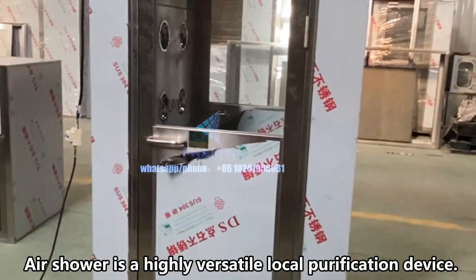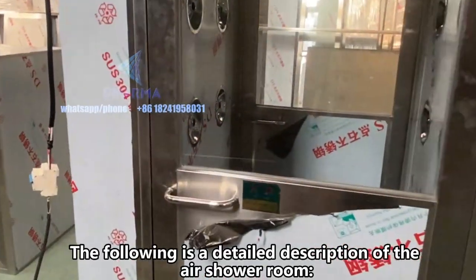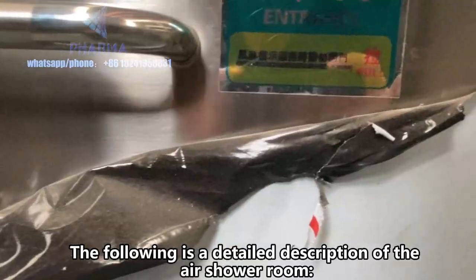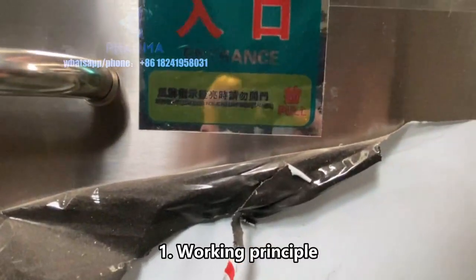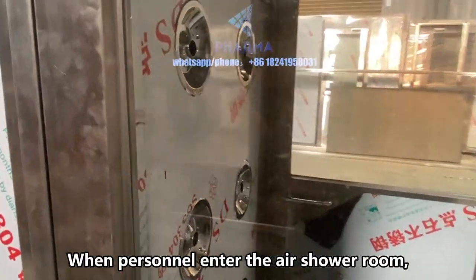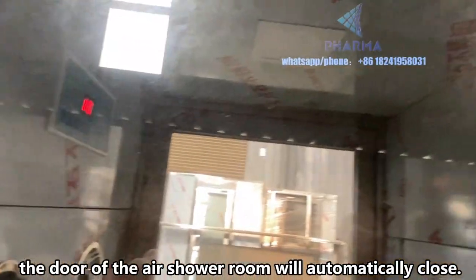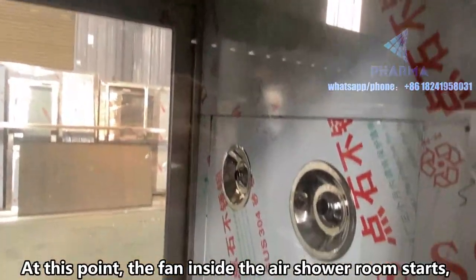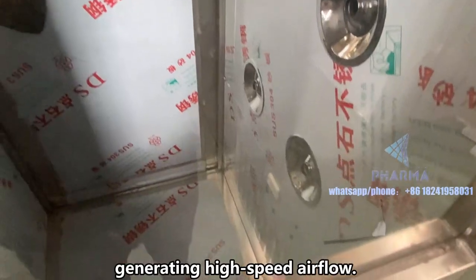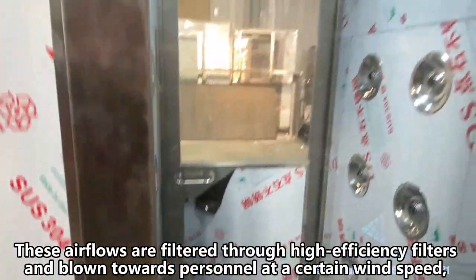An air shower is a highly versatile local purification device. Working principle: when personnel enter the air shower room, the door automatically closes. At this point, the fan inside the air shower room starts, generating high-speed airflow. These airflows are filtered through high-efficiency filters.